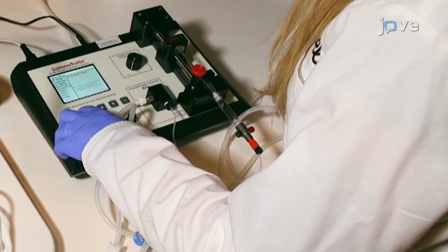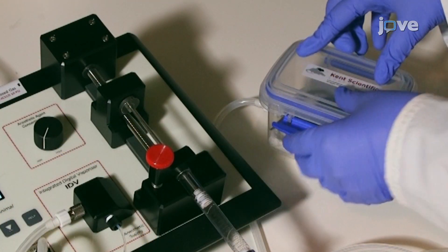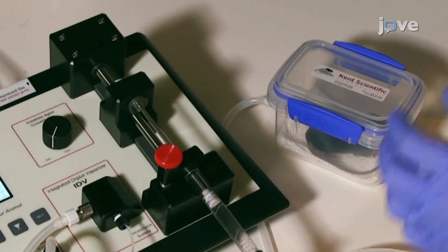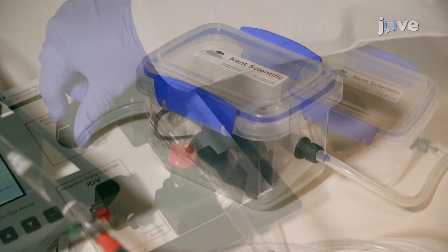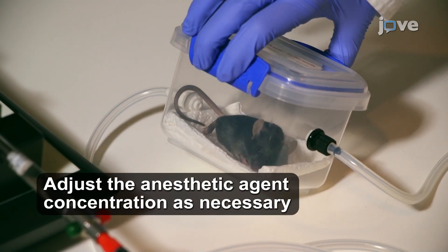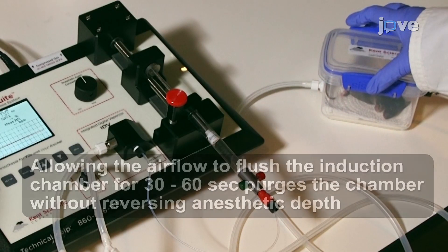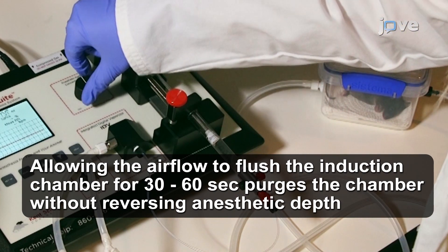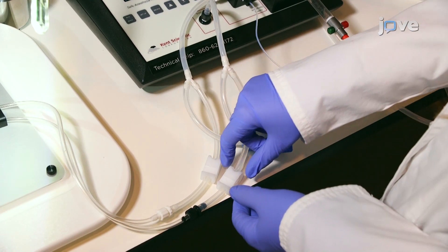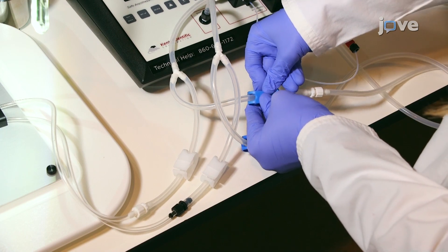Begin the airflow to induce anesthesia in the mouse. Place the mouse in the induction chamber, close the lid tightly, and adjust the anesthetic agent concentration dial to deliver 3%. Monitor the mouse until it reaches the desired plane of anesthesia, determined by loss of the righting reflex. Once the animal is sufficiently anesthetized, turn the anesthetic agent concentration dial to deliver 0%. Then, open the clamps to direct the airflow to the nose cone and close the clamps leading to the induction chamber.